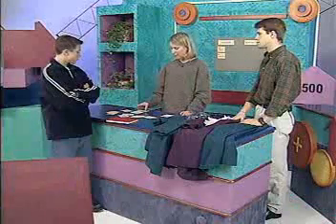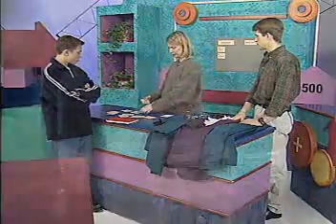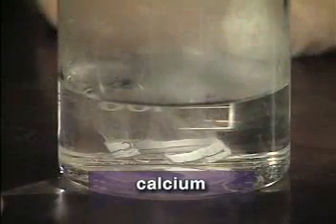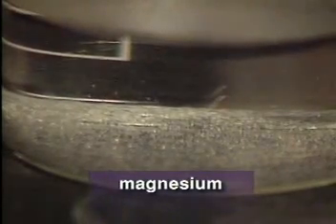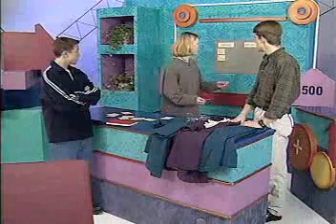And what about calcium and magnesium? Well, they both needed extra energy before we could see a reaction. And there weren't enough bubbles to bring them up to the surface. And the bubbles were slow to form. Which means they're not nearly as reactive as sodium and potassium. So, they'd probably go in a separate group.